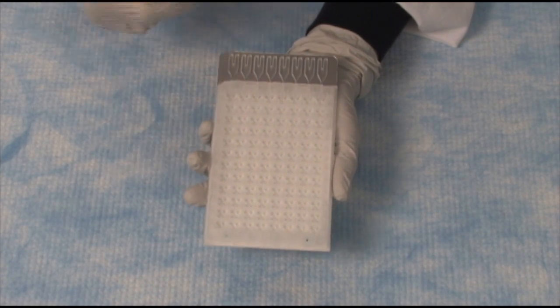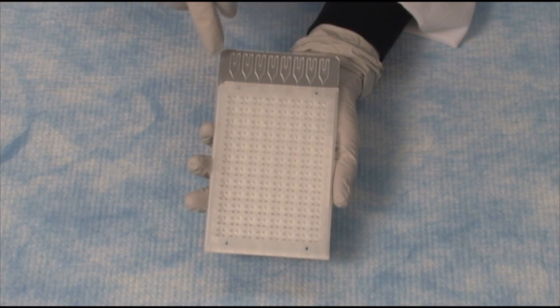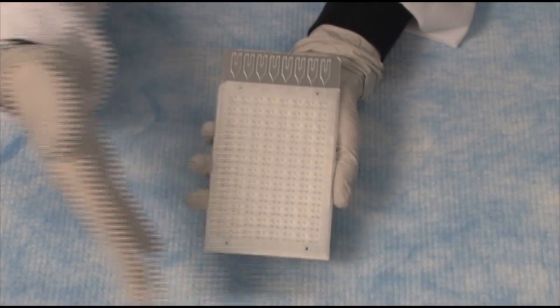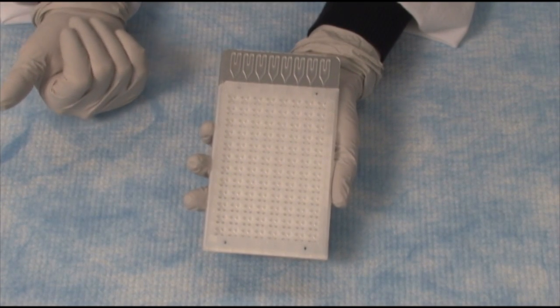The fill ports have two different holes — one is to fill, and the other is an air port. So this is a very simple procedure. You fill up each of these eight ports — you've pipetted eight different times — and now you're going to be interrogating 384 different spots. Depending on the format of the card, it will determine how many samples and how many genes you can look at.